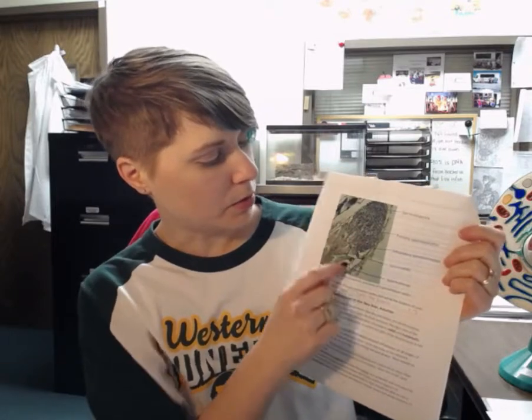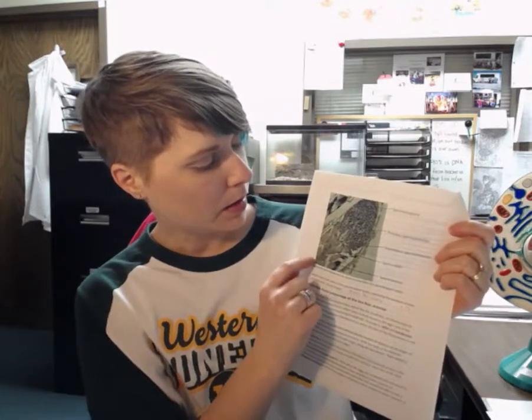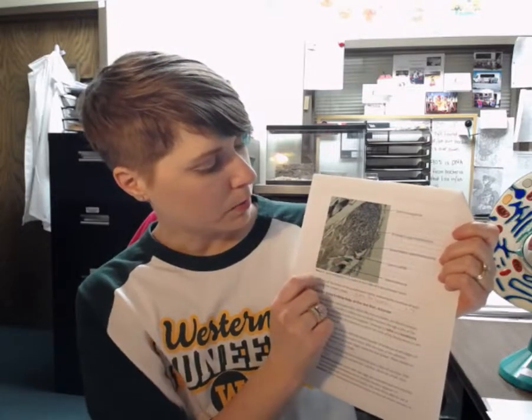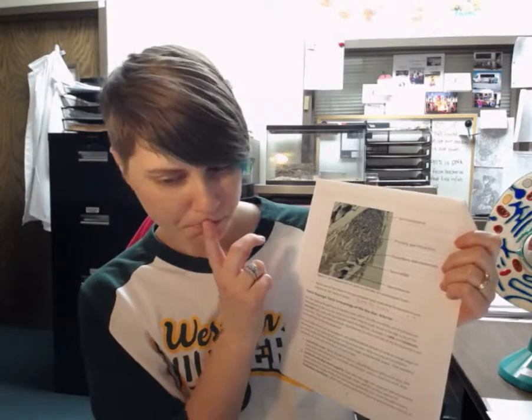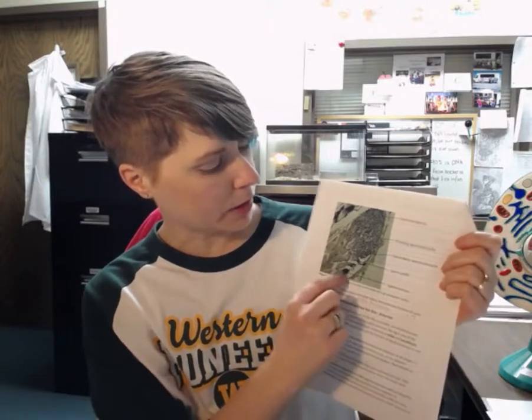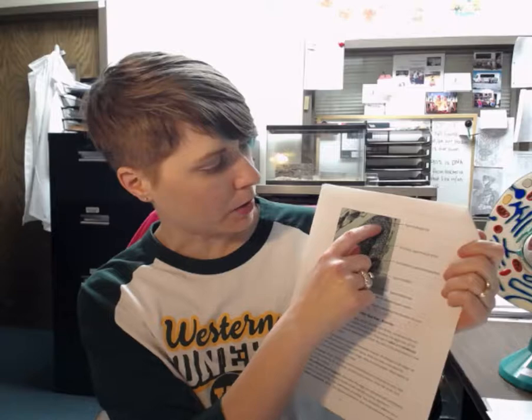Okay, so make sure that when you're looking at the lobe, like I'll already have it set up on the microscope, make sure that you can orient so that you know, okay, up here, then that would be spermatogonia, and then down here you can actually see where the flagella of the spermatozoa would be developing, and so this is going to be the spermatozoa. Okay, so now I know which direction it is, and so I'm going to ask you to identify 2 of them, like spermatozoa down here, or like spermatogonia up here.